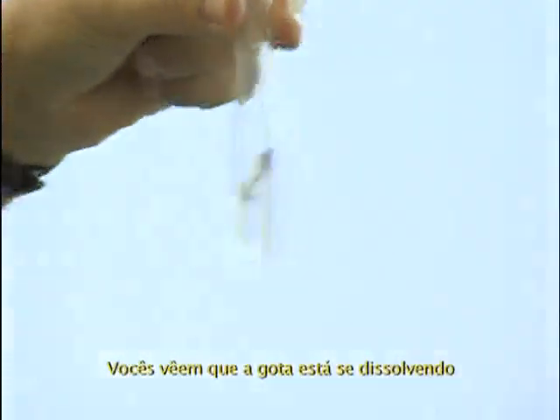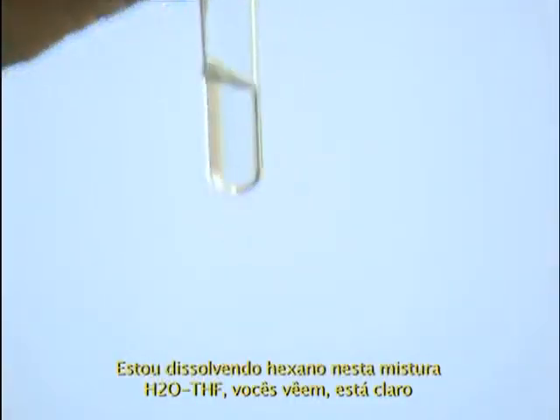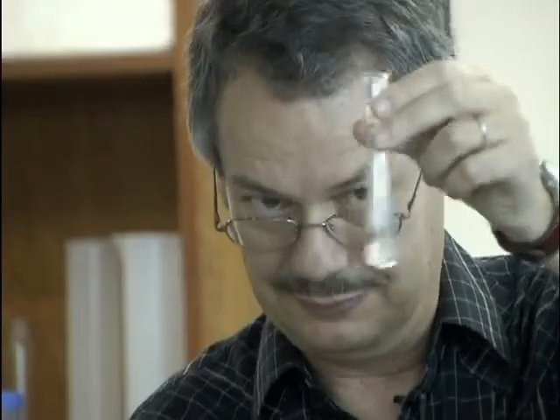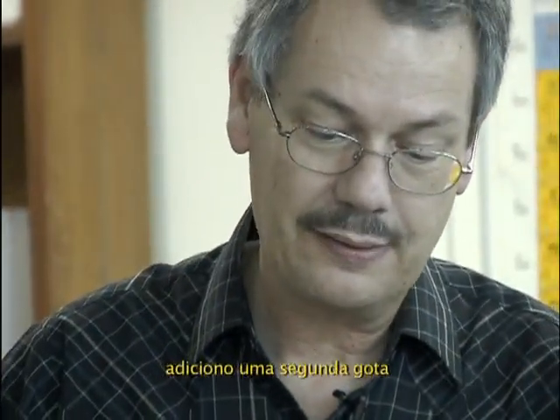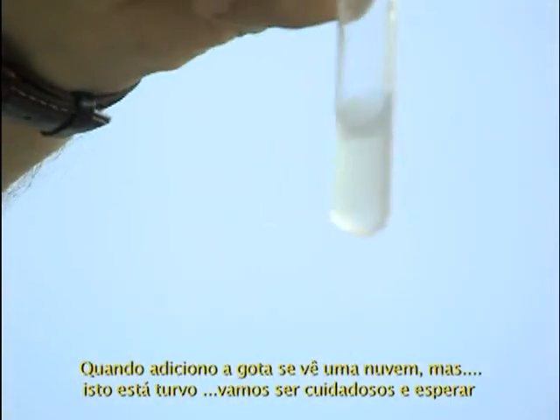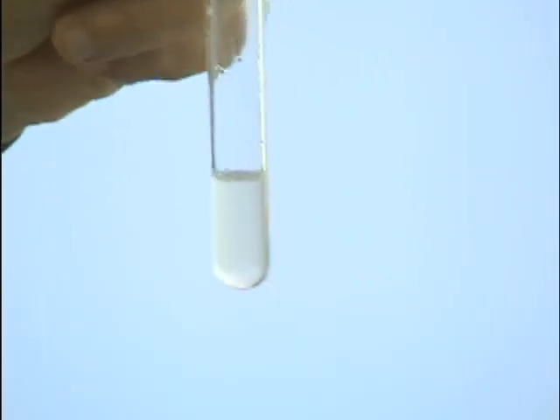You see the drops dissolving, making a cloud, and the cloud disappears. It's solubilized. I am solubilizing hexane in this water-THF mixture. It's clear. It's maybe difficult to see, but it's still clear. Put a second drop. When I put the drop, you see some cloud. This is cloudy. So let's be careful and wait.